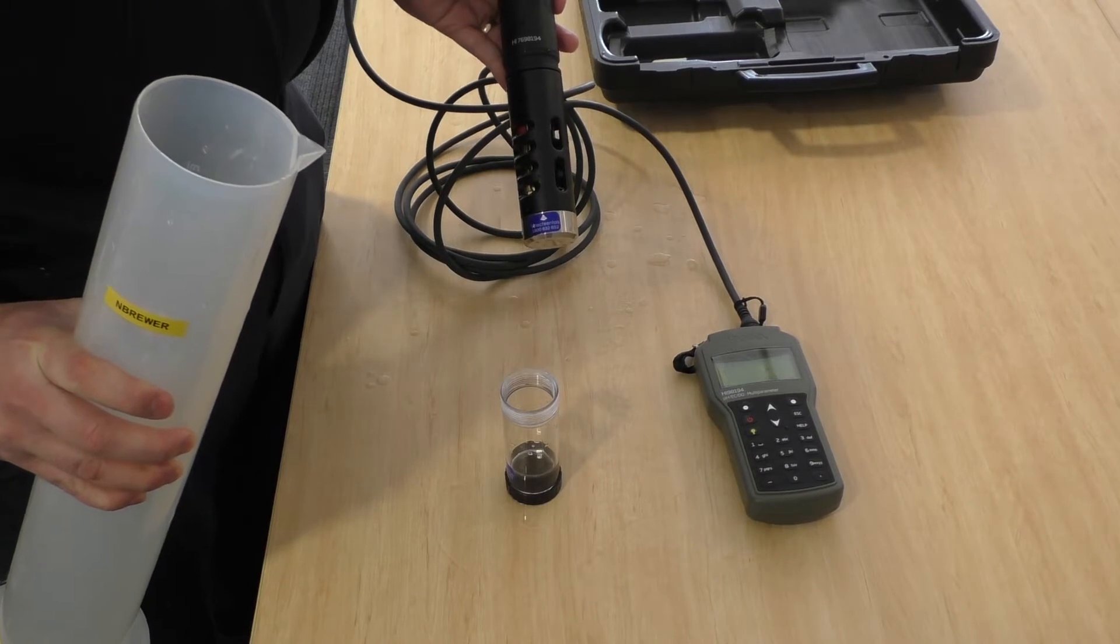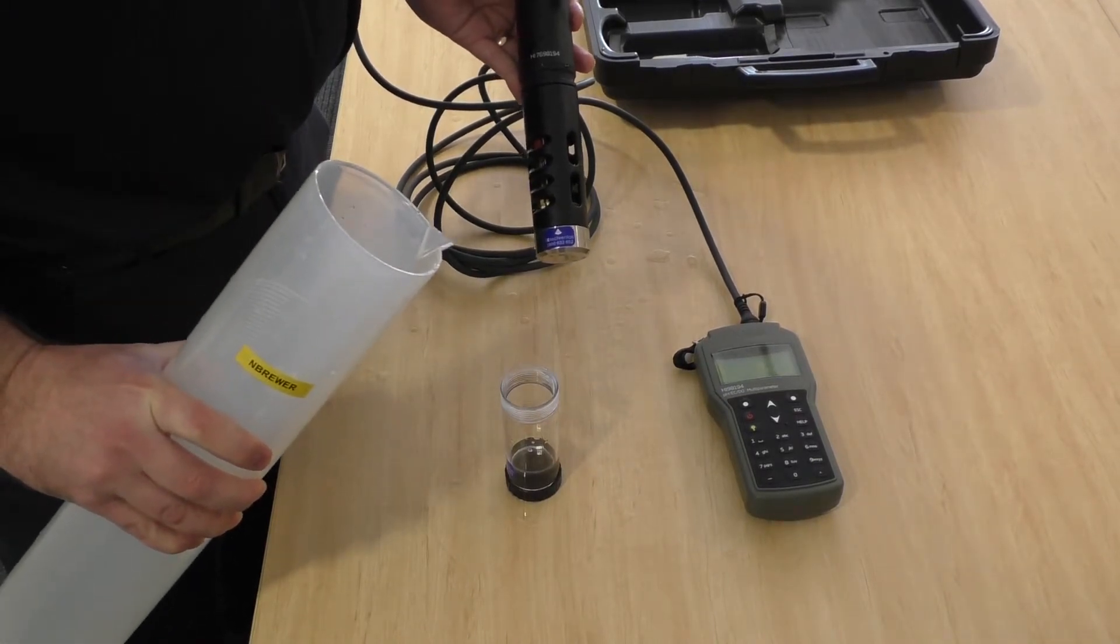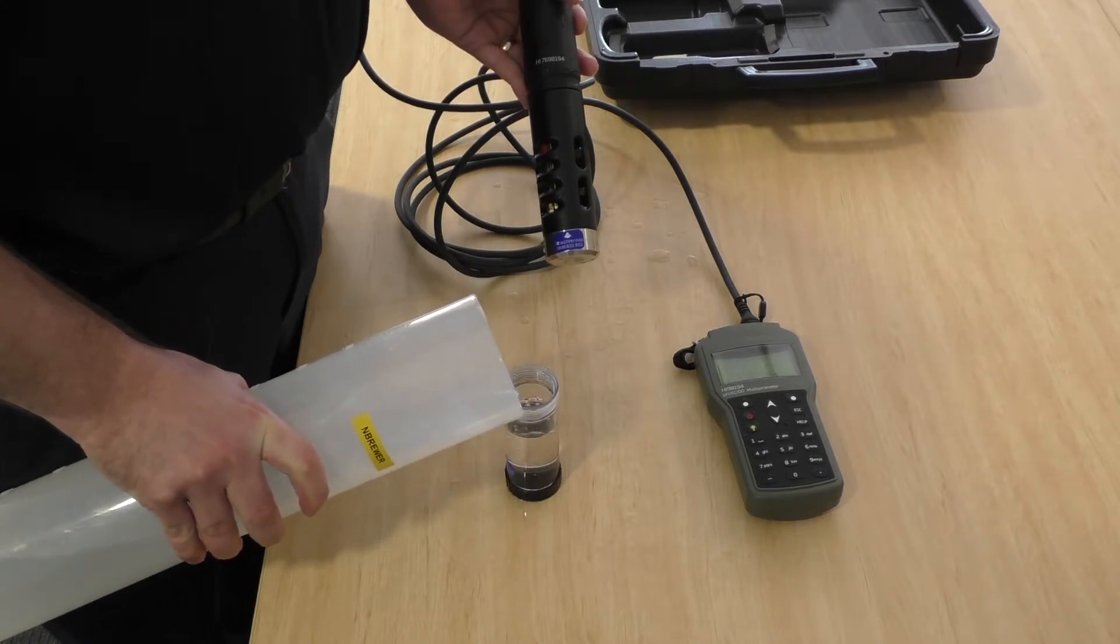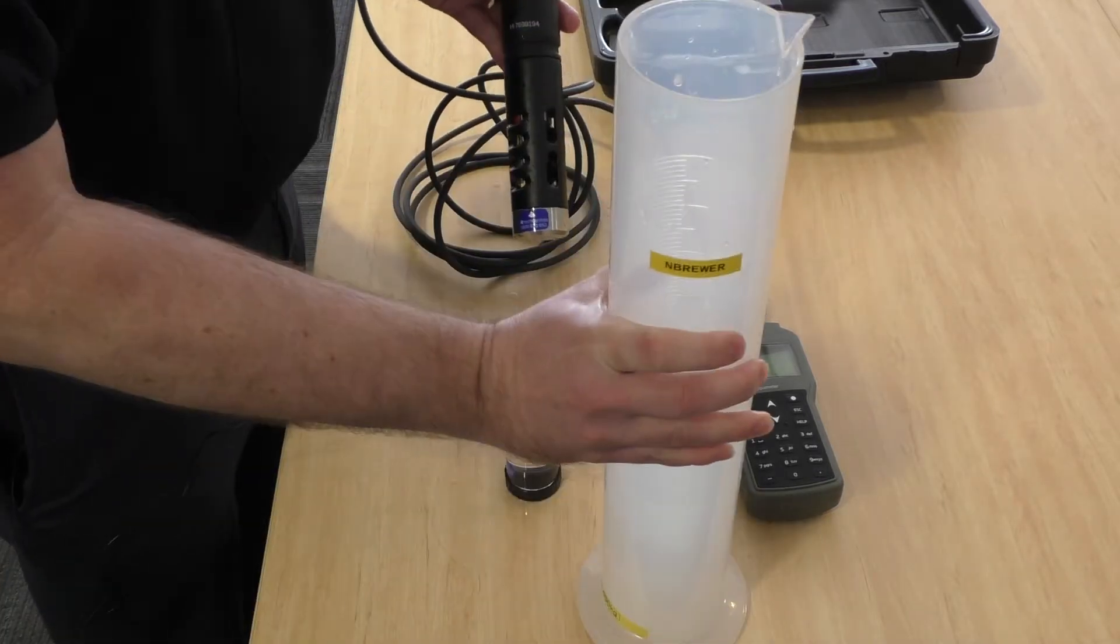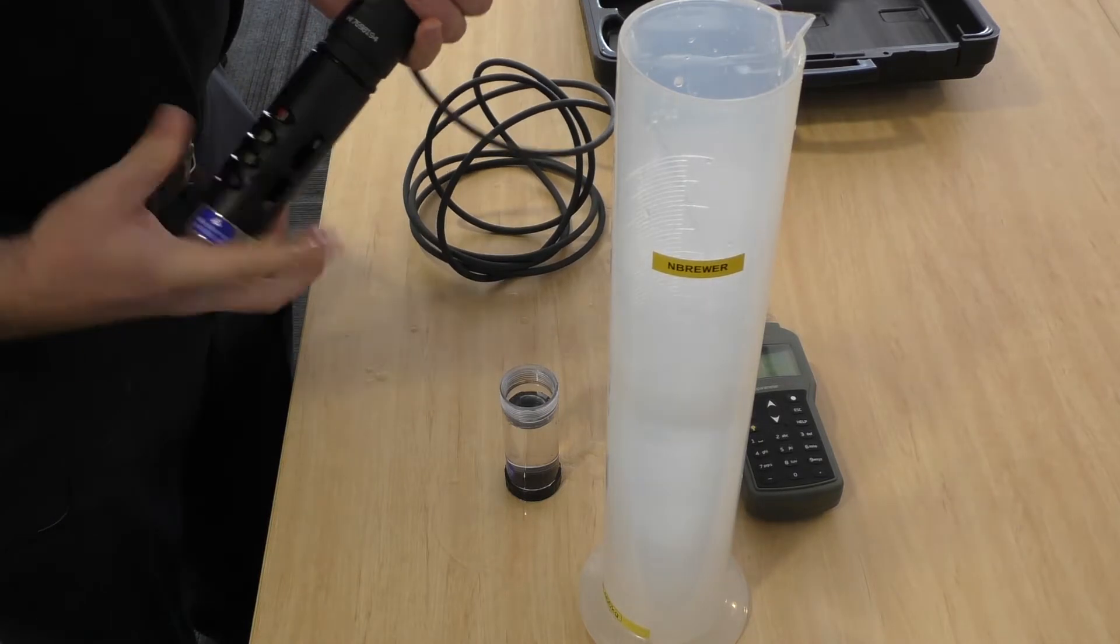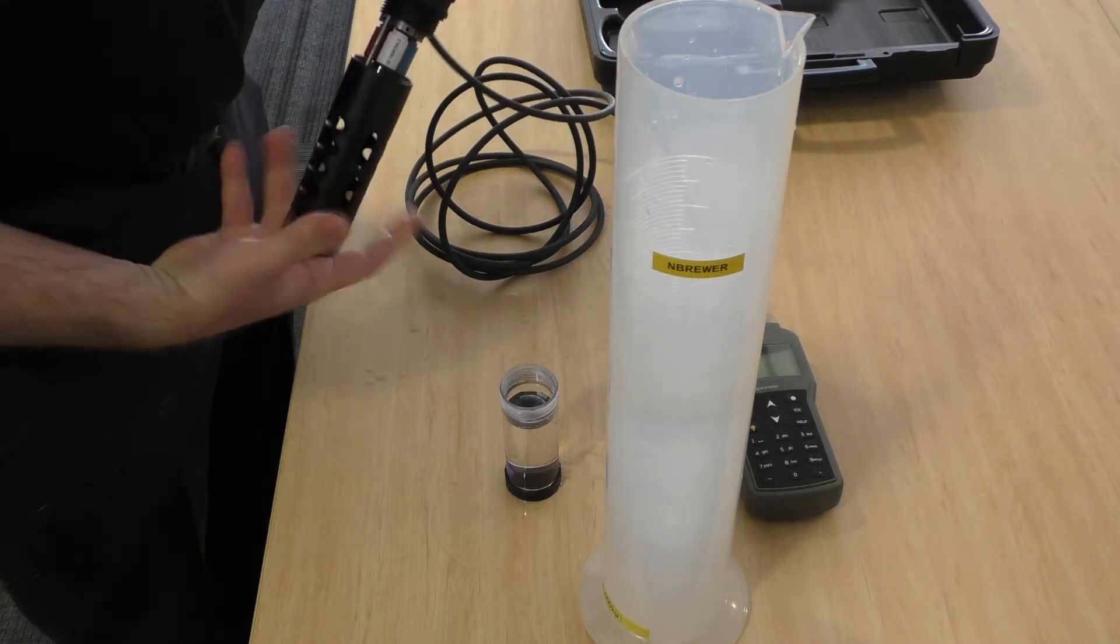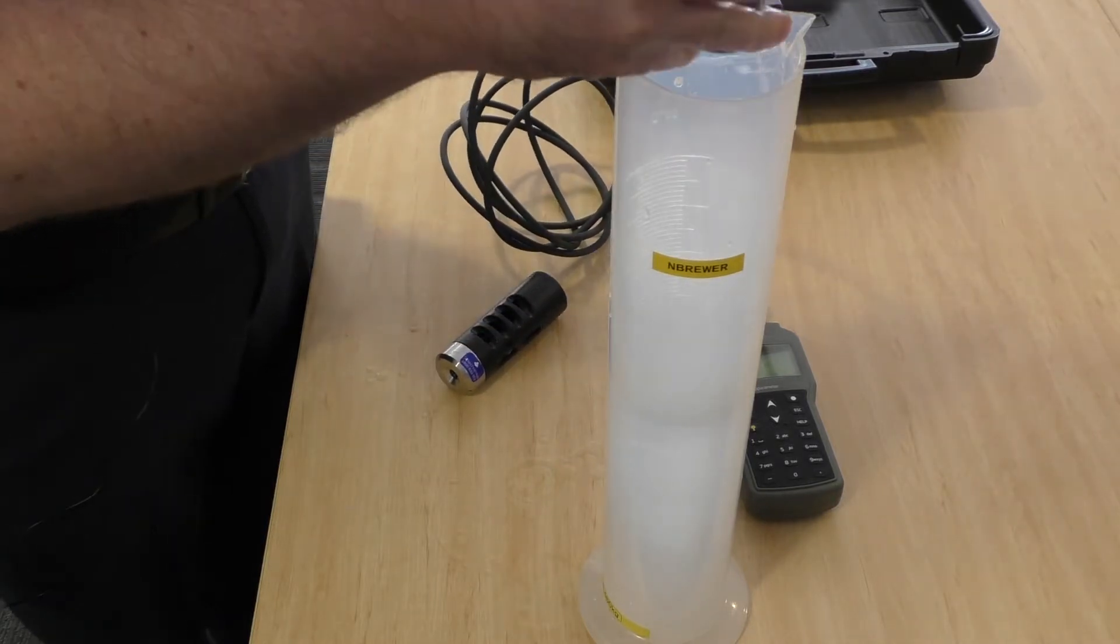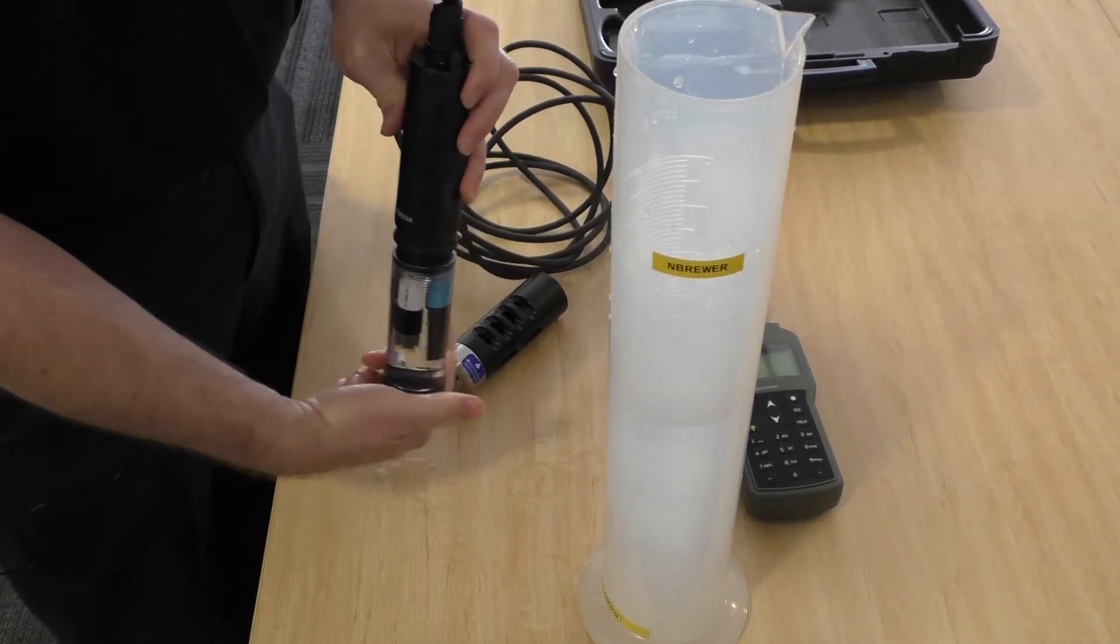So once you've finished using the instrument for the day, or any big gap during the day, just have some tap water into the storage cup, remove the shield and screw that in. Just be careful it will overflow a bit.